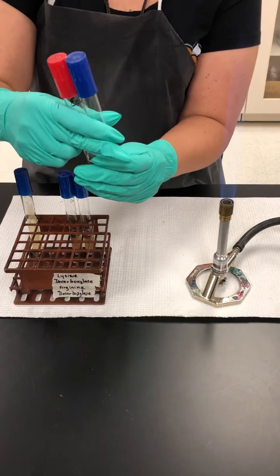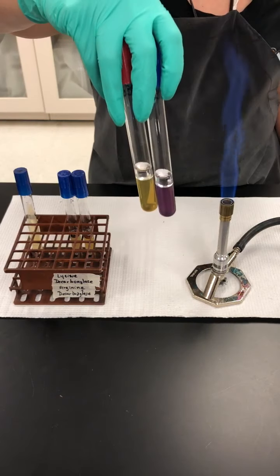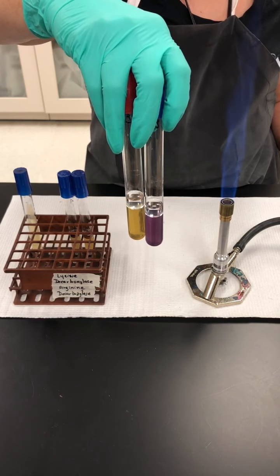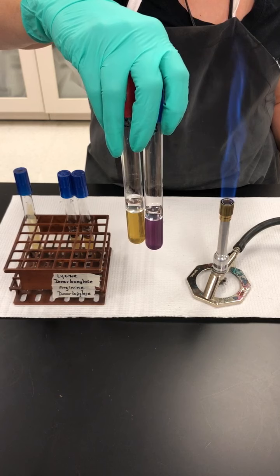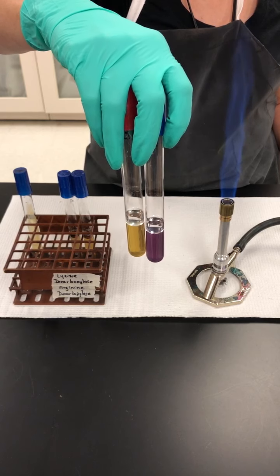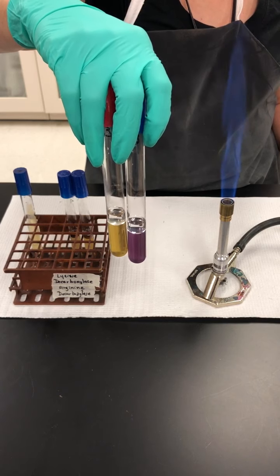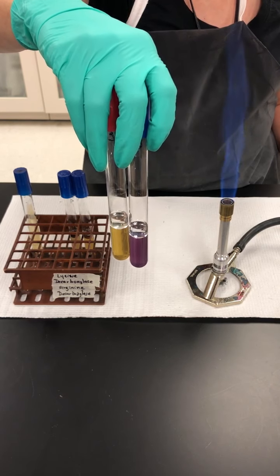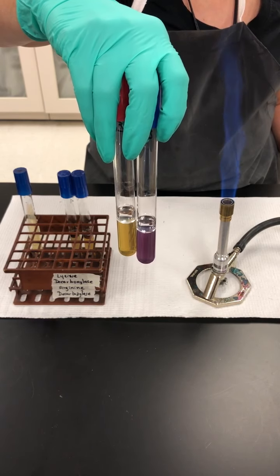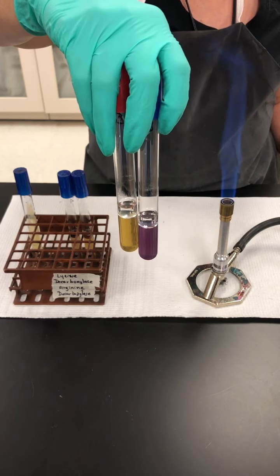Here you have the lysine decarboxylase tubes. The yellow color indicates fermentation of the glucose that was present in the media, because the pH indicator is going to change if it's acidic and if it's alkaline. After the glucose runs out, the bacteria could potentially use the amino acid if they have the right decarboxylase. When you have the breakdown of amino acids, the pH goes up instead of down, so we will have that purple color. That purple color is what we want to look for as the positive. The yellow is a color change, but it doesn't mean anything for what we're looking for.